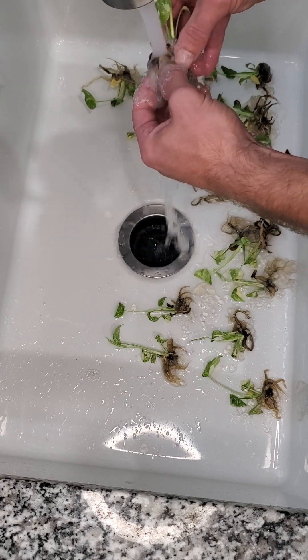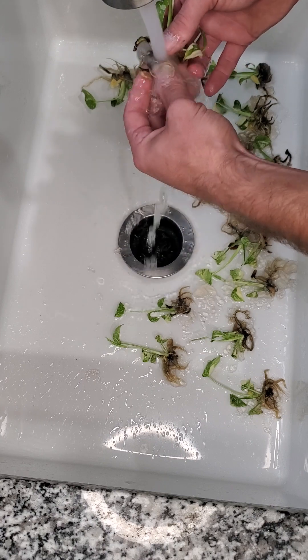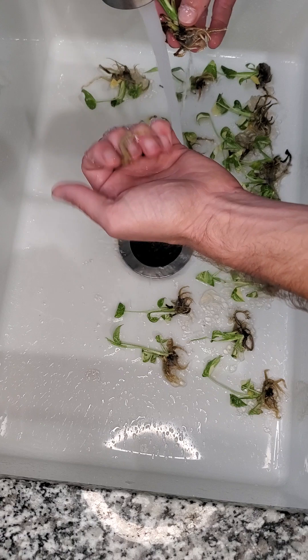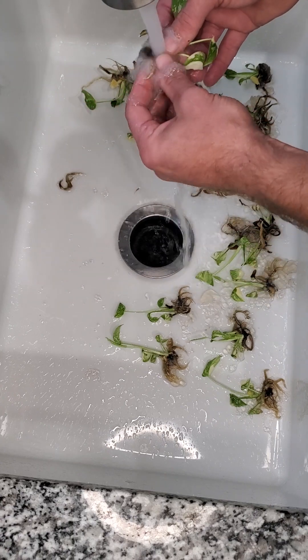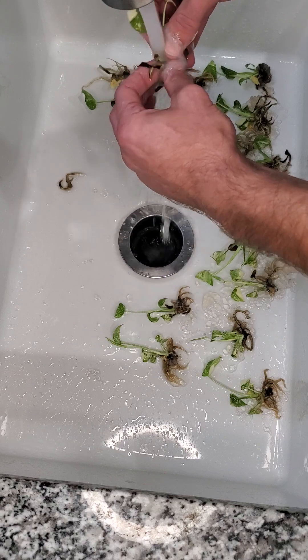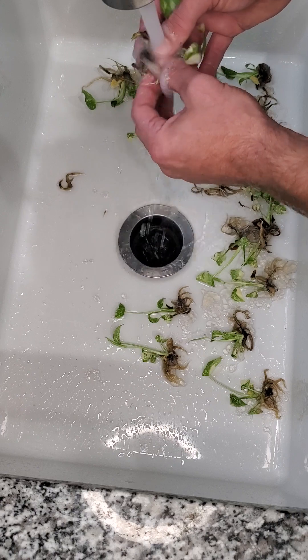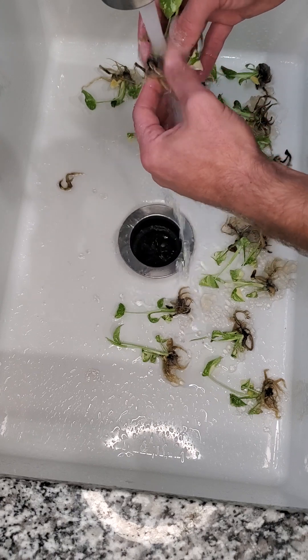So I'll just start getting the bulk of the gel off — just most of it. I'm not overly gentle. I do lose roots in the process, but most of those are roots that have damage or are just a little weak to start. Again, not going to be the end of the world. You'll still end up with a quality plantlet by the end of the process, and it'll be easy to acclimate.